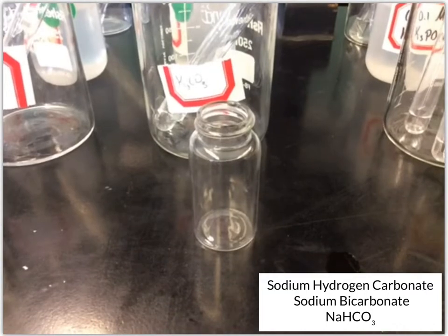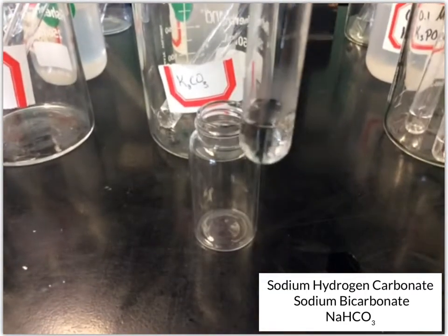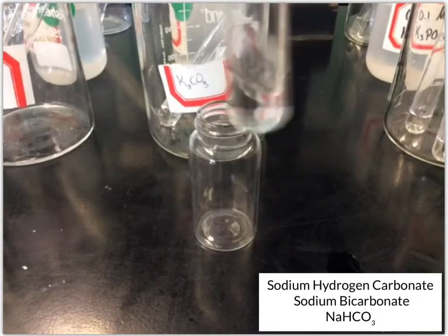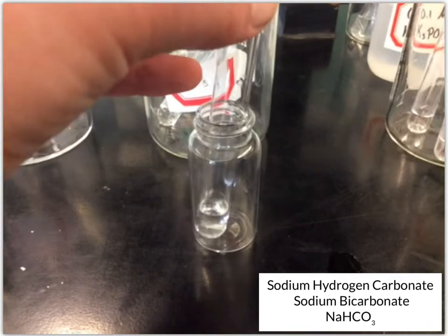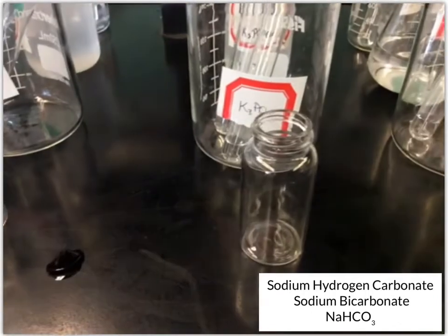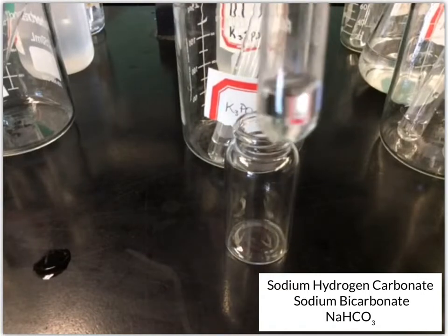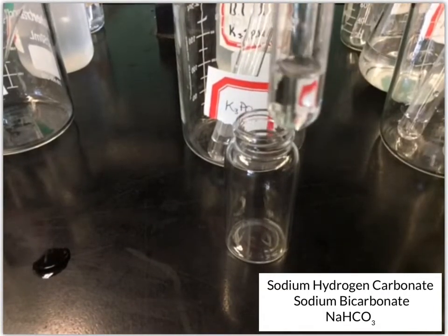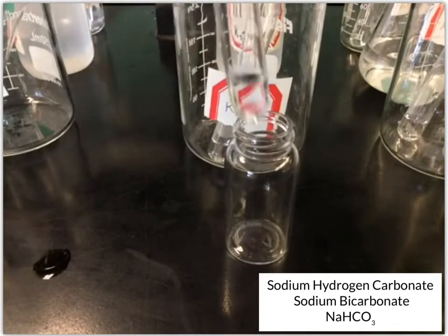Okay, now we have our potassium carbonate. Looks like no change. And then our potassium phosphate. And also looks like no change.